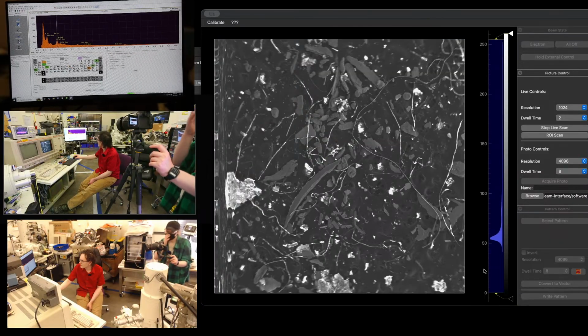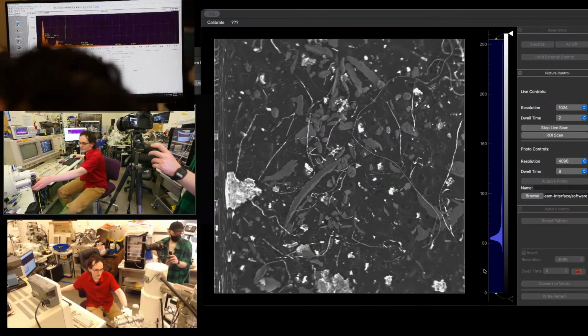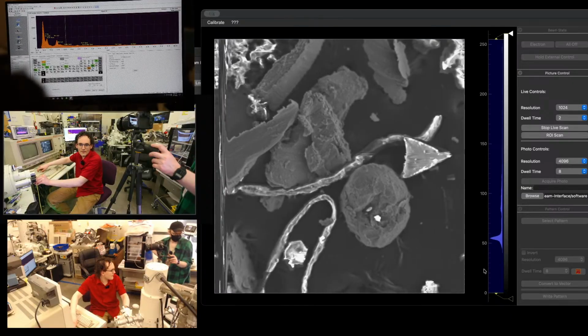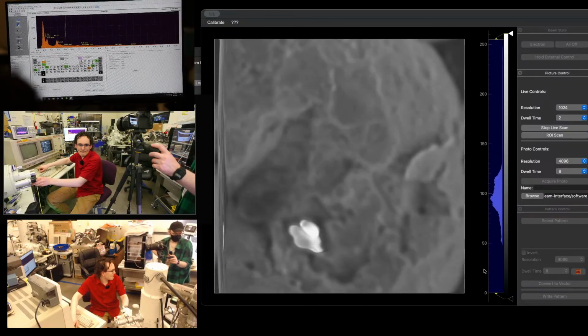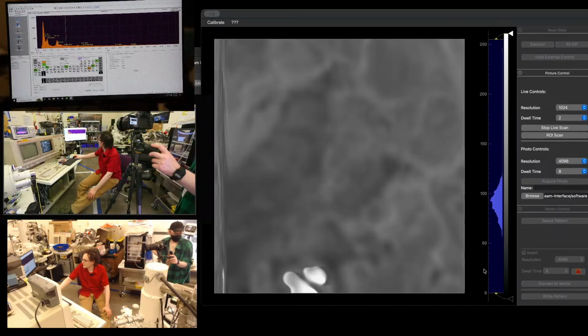Okay, now it's starting to think about aluminum. There we go. Okay, that's now on peak. I'm not liking the data from that. Let's just zoom in and check out a few more, and then I think we'll wrap up the stream. But aluminum does point to turbopump rotor, I believe.